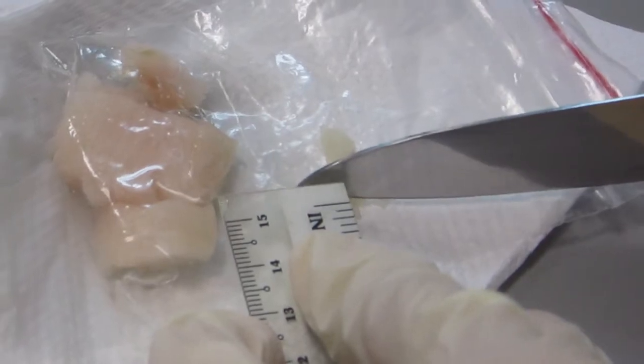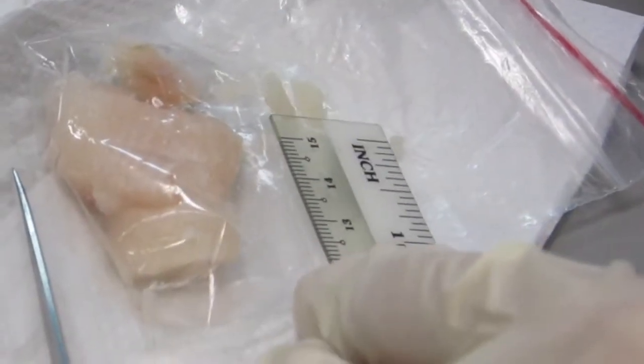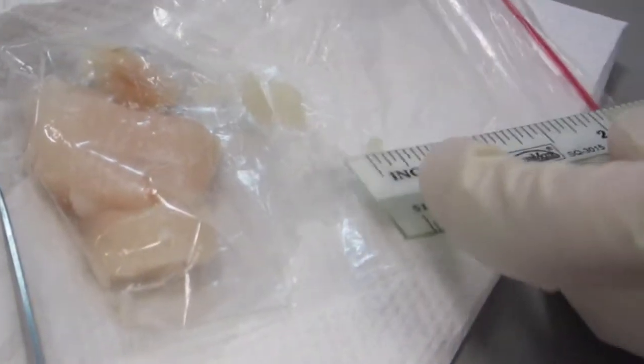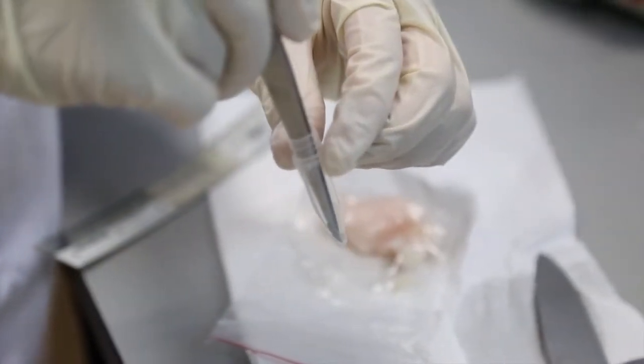Step 1: The protein sample is cut to a dimension of 0.1 inch for the width, breadth and thickness, which is then transferred into a labeled screw-capped microtube.